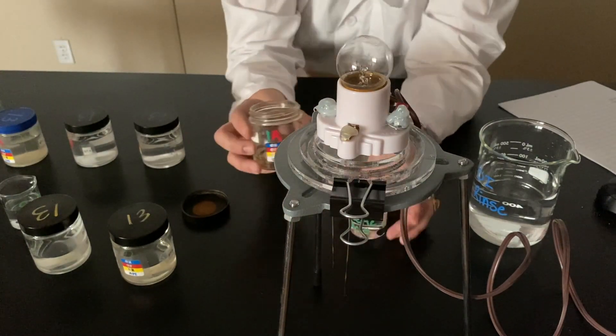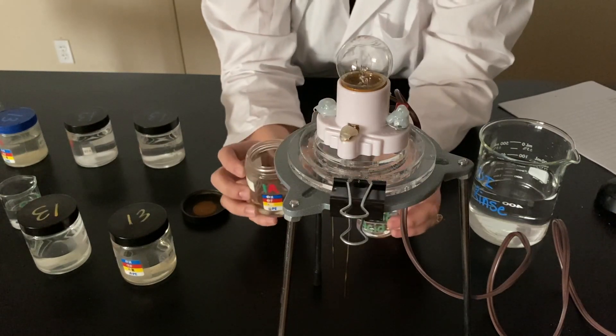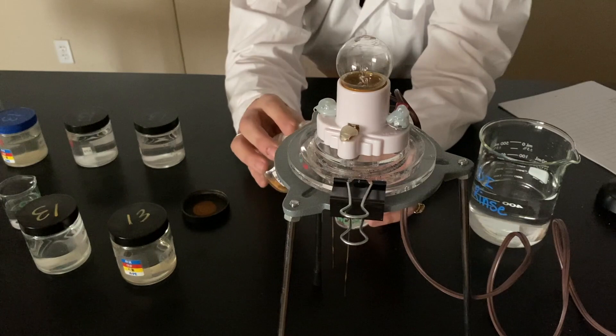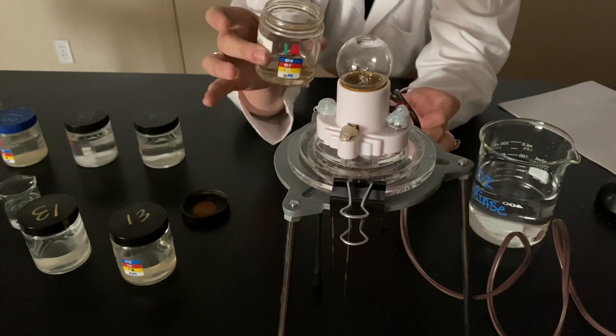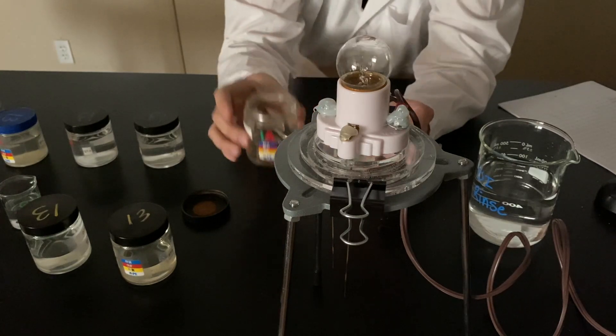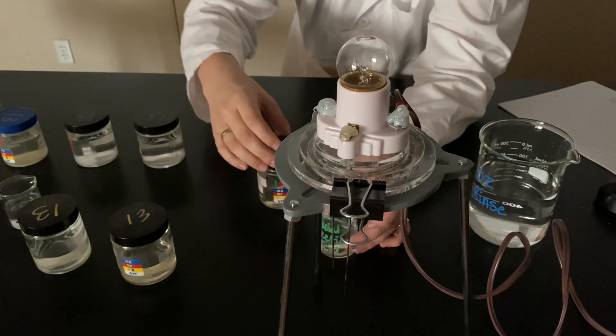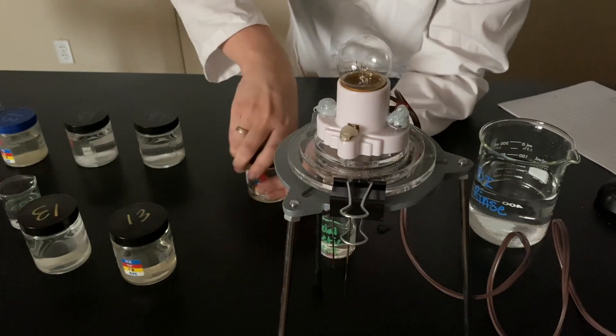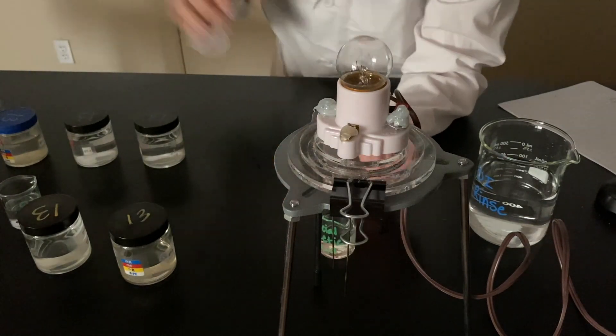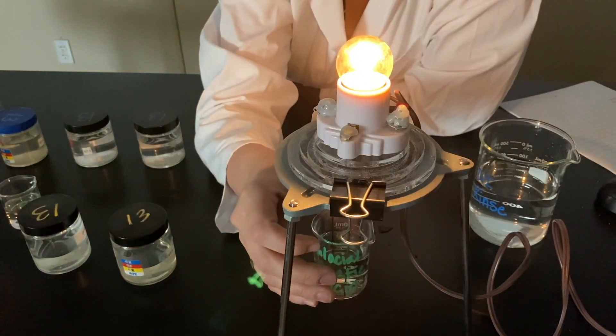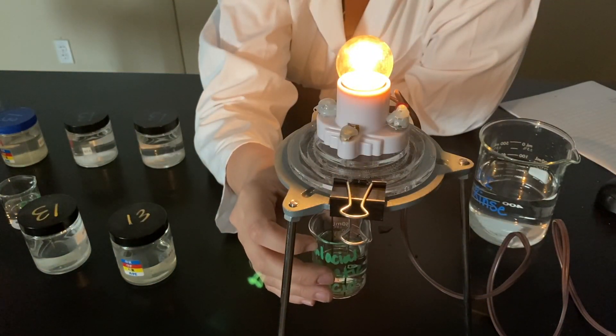I have an aqueous acetic acid. So, that means it's mixed with water. It's a very strong vinegar smell. So, I'm going to pour some of my acetic acid into my DI water. I'm making a solution. We'll cover that up. Smell strong with that one. Here's acetic acid aqueous.